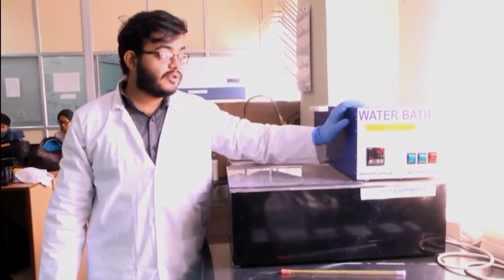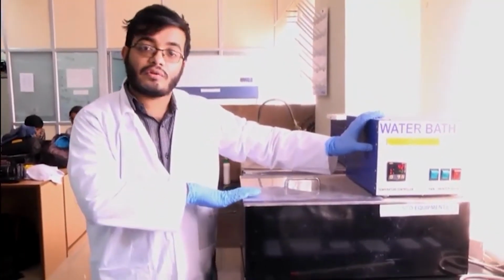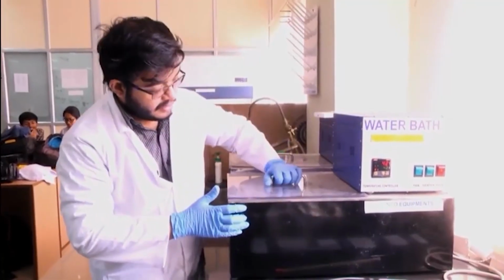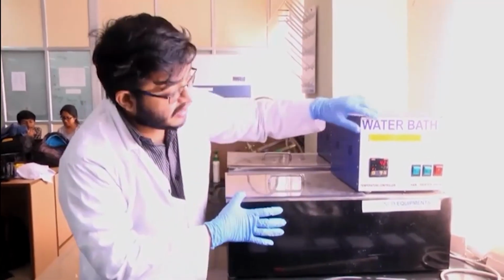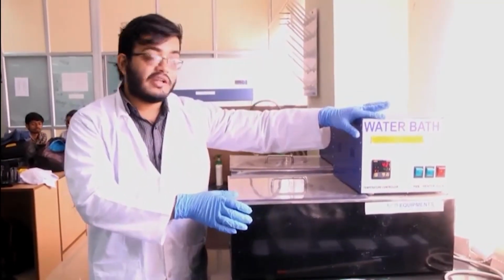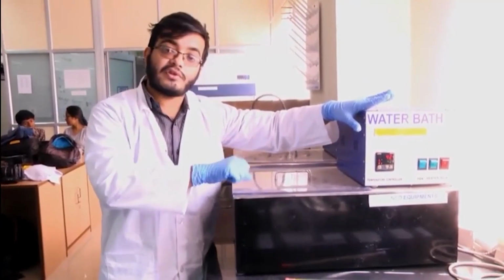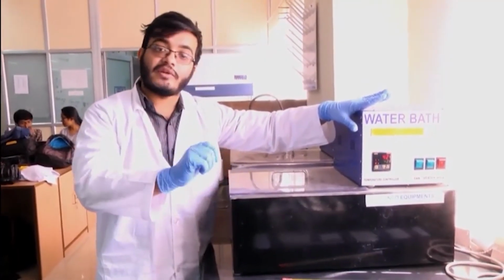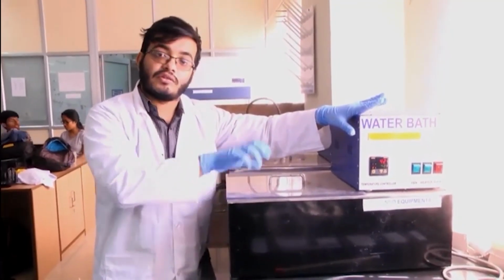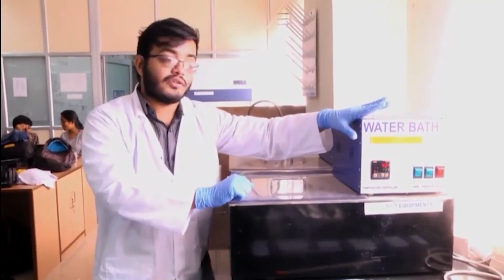But apart from that we also have water baths in our laboratory. So this is the water bath, and this portion of the tank has water which for now is maintained at 42 degrees centigrade. That is because later on today I will be doing an experiment in which I require the temperature to be at 42 degrees. I will take my sample in a centrifuge tube and I will just keep it inside this water bath. It will float inside the water bath and the reaction will be incubated at 42 degrees.